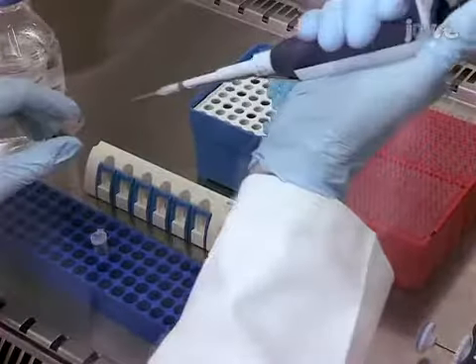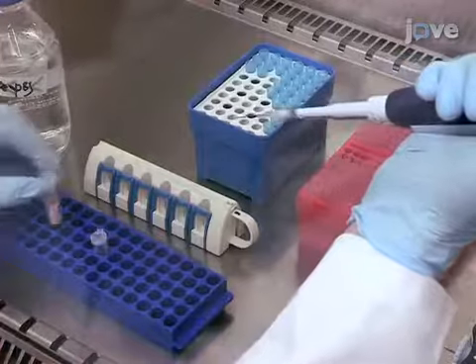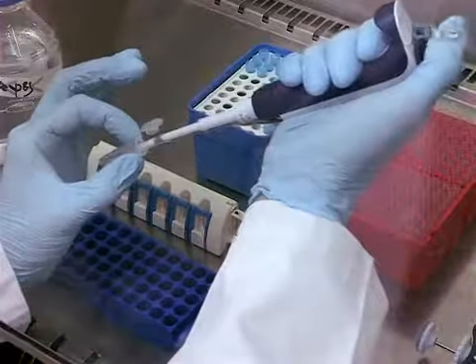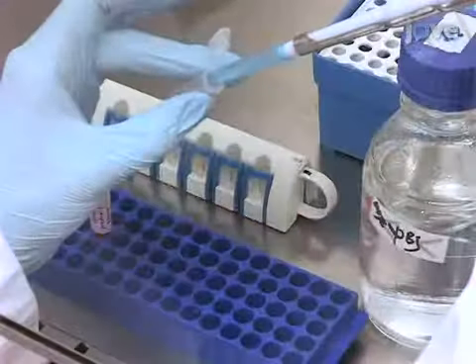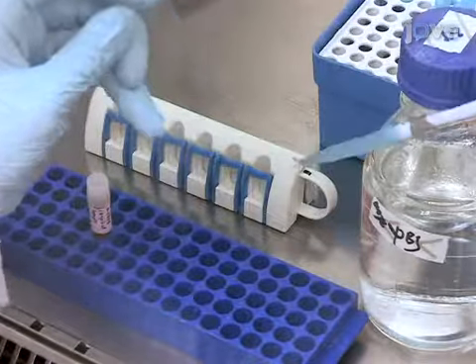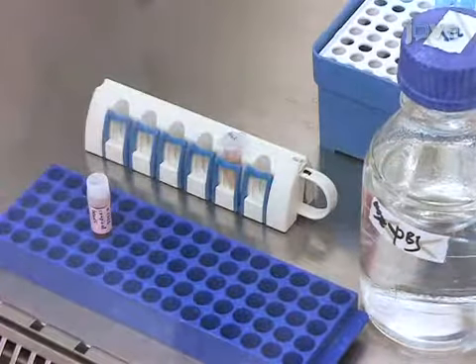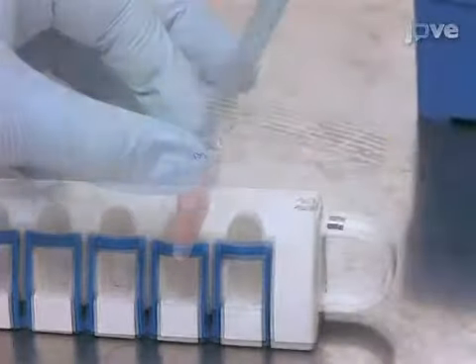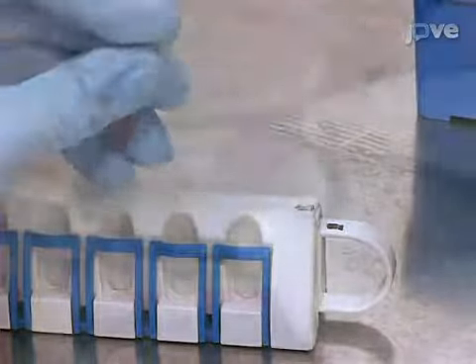To activate and polarize the T cells, pipette anti-CD3 and anti-CD28 coupled beads into a small reagent cup. The number of beads should be equal to the number of cells. Then, add tenfold the volume of PBS and place them on a magnet for 2 minutes. Next, take off the supernatant and resuspend the beads in 200 microliters of polarizing medium.